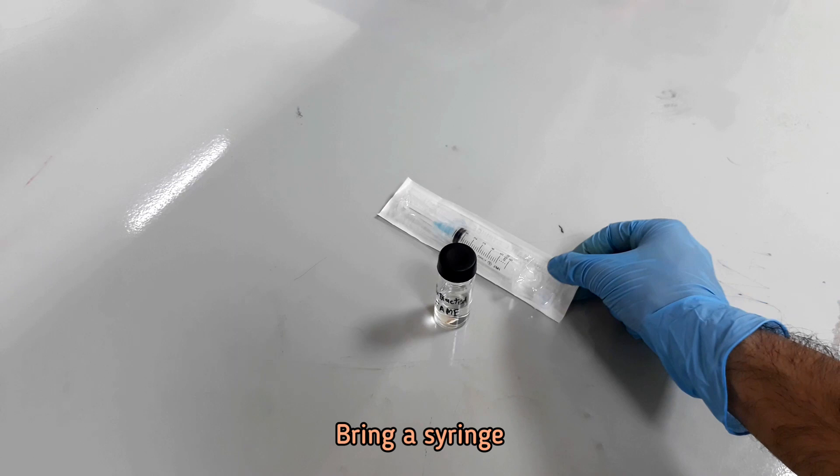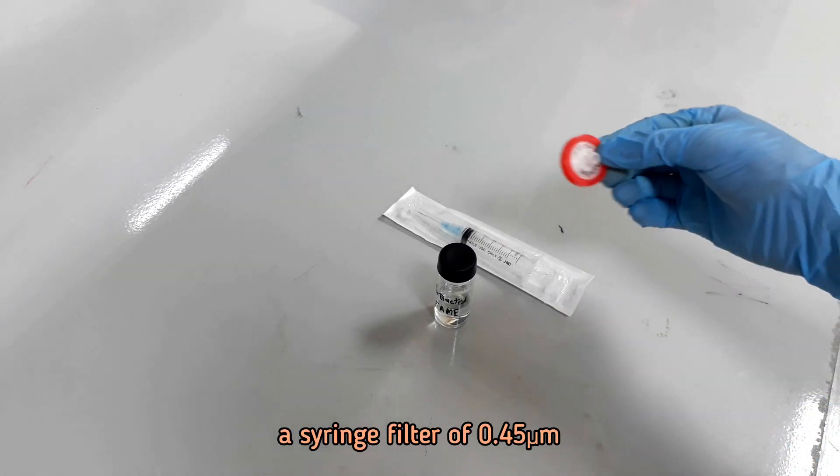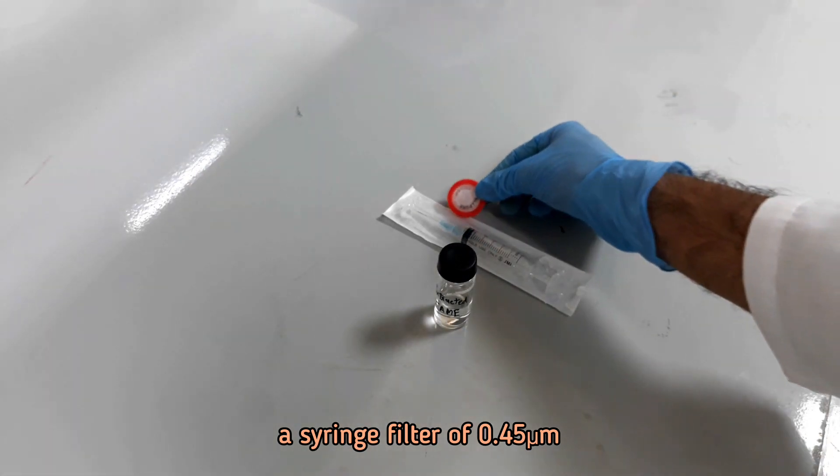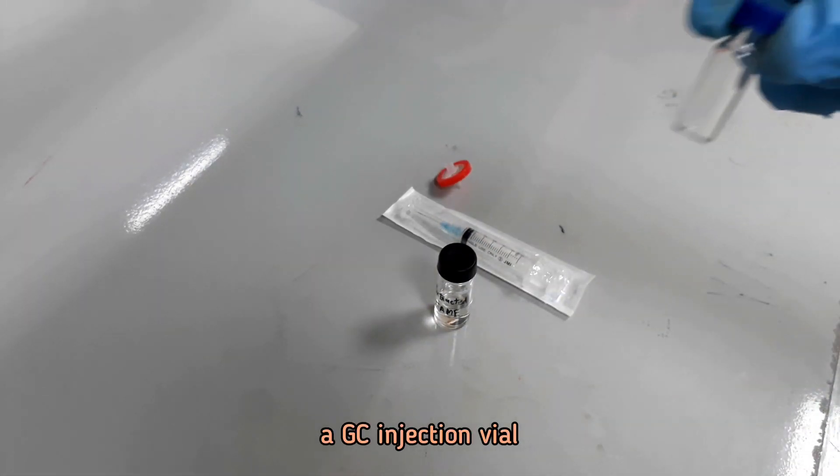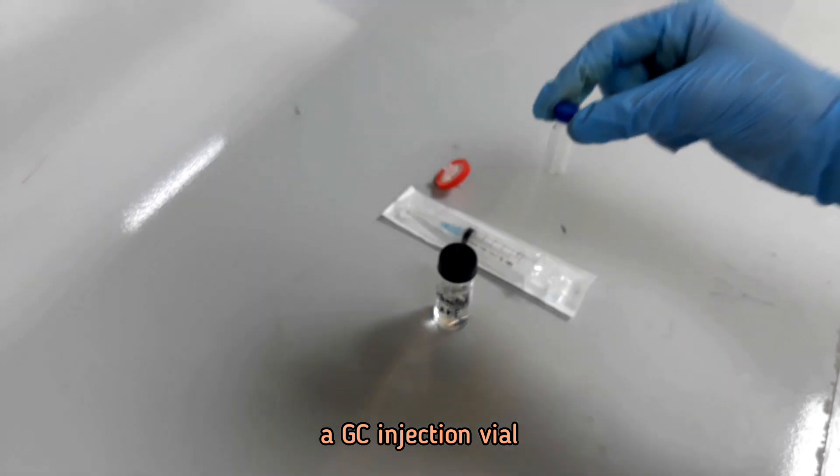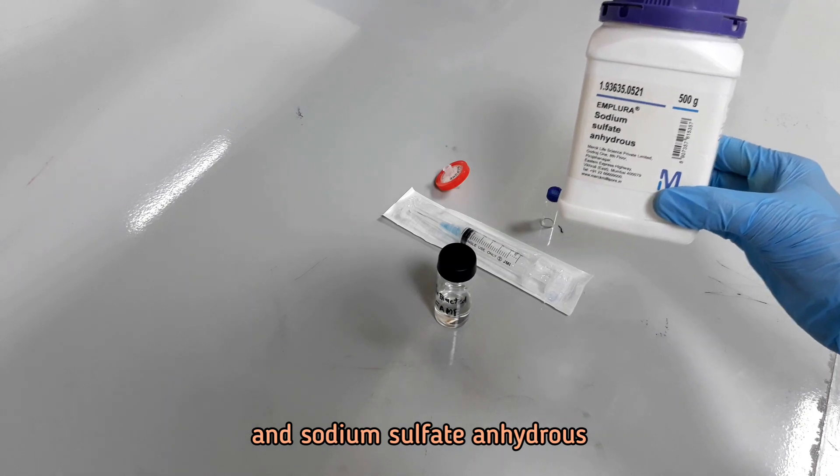Let's bring a syringe, a syringe filter of 0.45 micrometer, a GC injection vial, and sodium sulfate anhydrous.